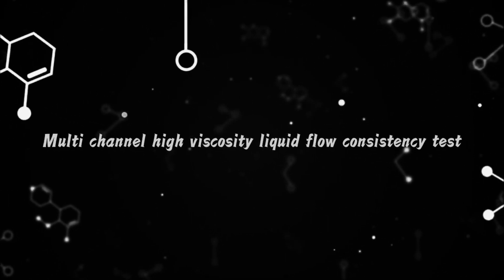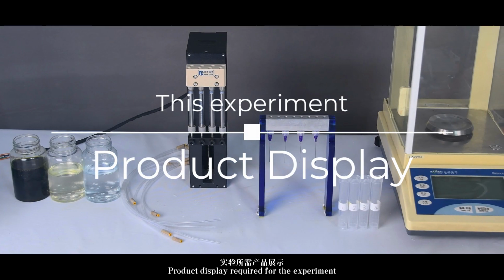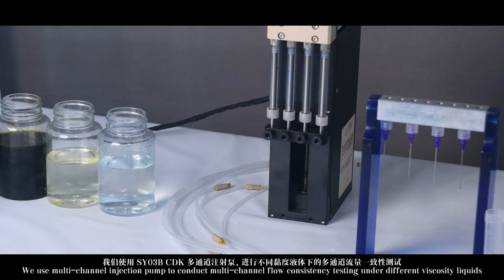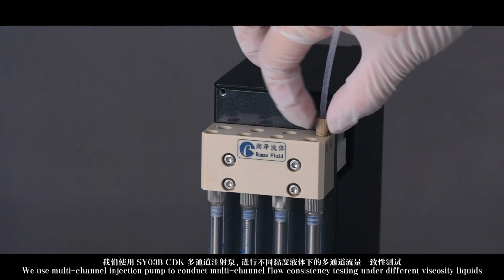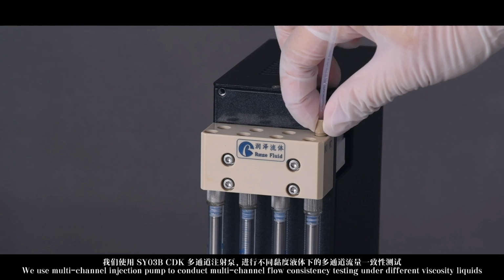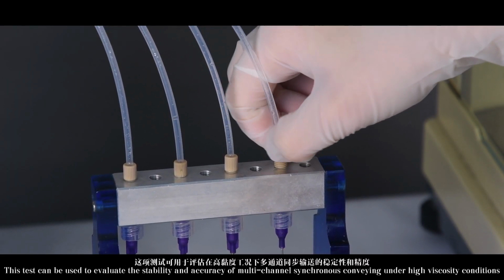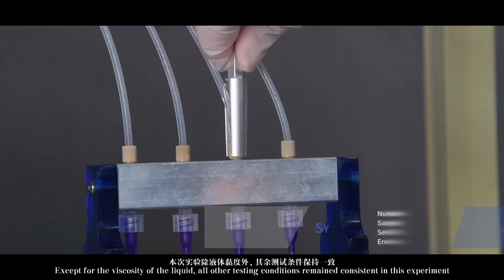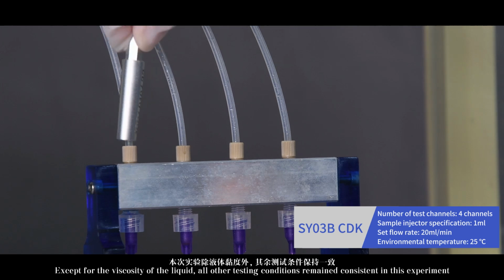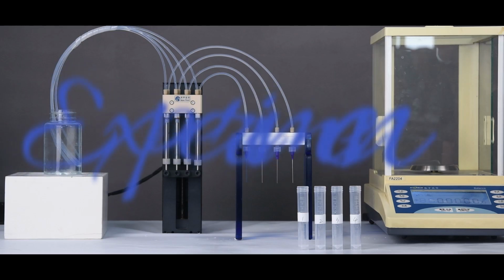Multi-channel high-viscosity liquid flow consistency test. Product display required for the experiment. We use a multi-channel injection pump to conduct multi-channel flow consistency testing under different viscosity liquids. This test can be used to evaluate the stability and accuracy of multi-channel synchronous conveying under high viscosity conditions. Except for the viscosity of the liquid, all other testing conditions remain consistent in this experiment.